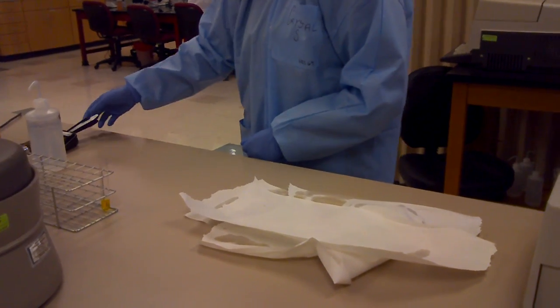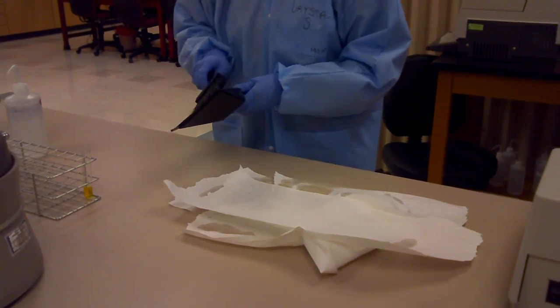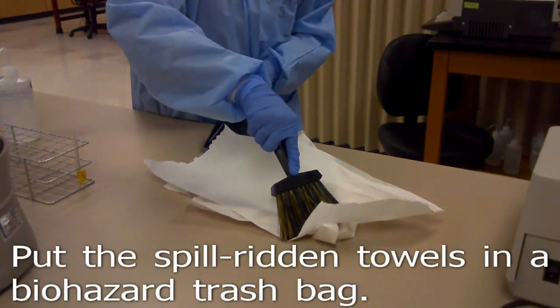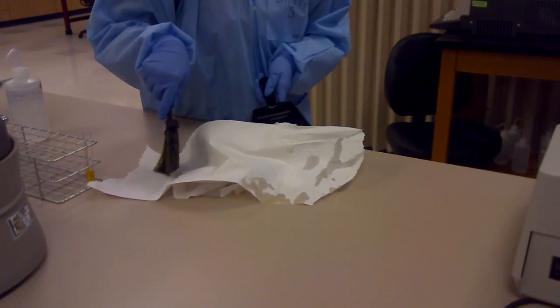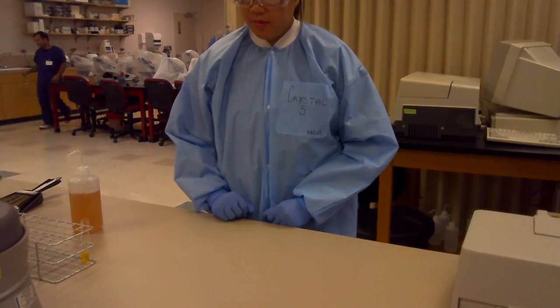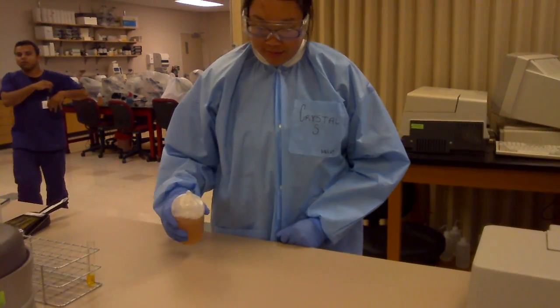Use a dustpan to sweep up the paper towels. Clean the area with two parts to 100 Amphyl solution and dry with paper towels.